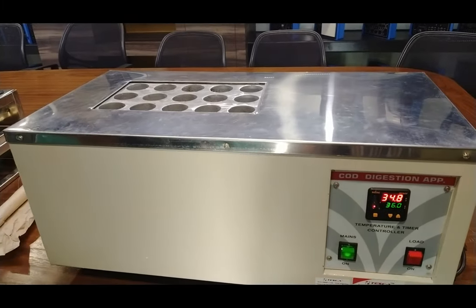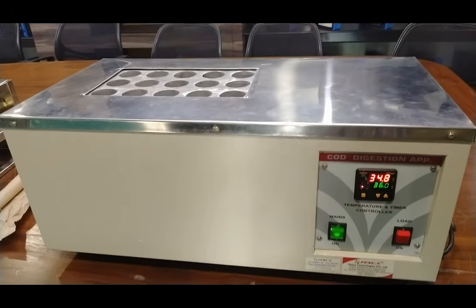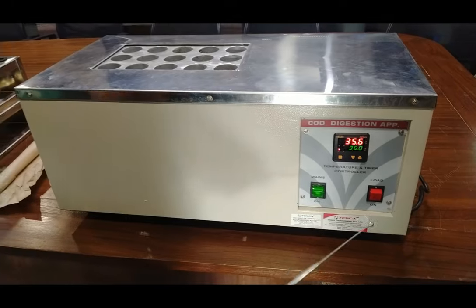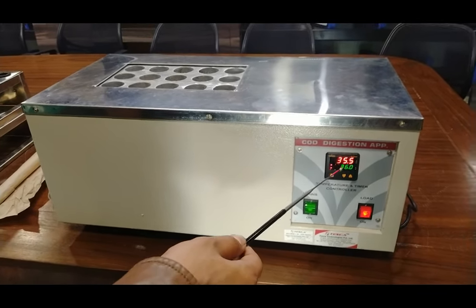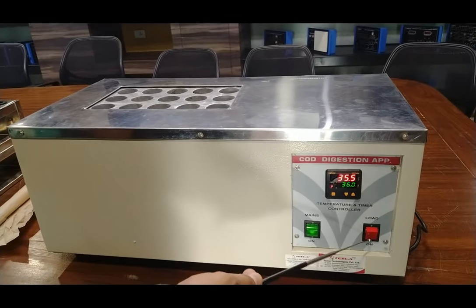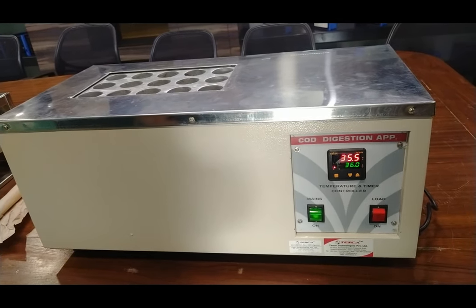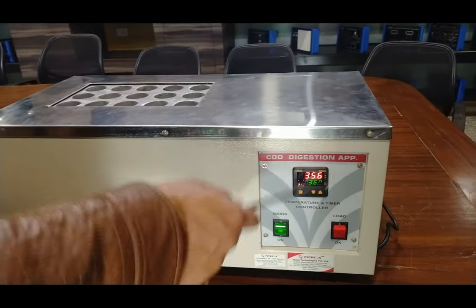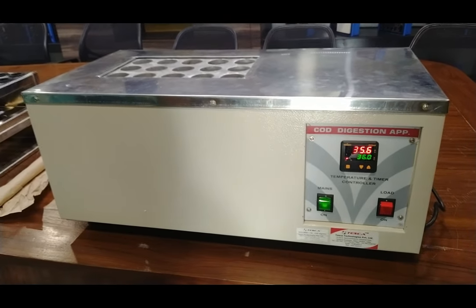The temperature is continuously increasing and now it is reaching nearby 36 degrees Celsius. You can see the blinking of the load switch — the time gap of blinking increases as we approach 36 degrees Celsius. This is because it is a PID controller and the PID controller will maintain the temperature at 36 degrees Celsius.